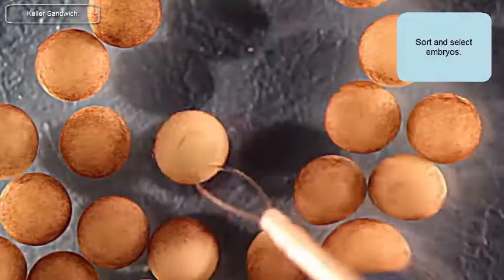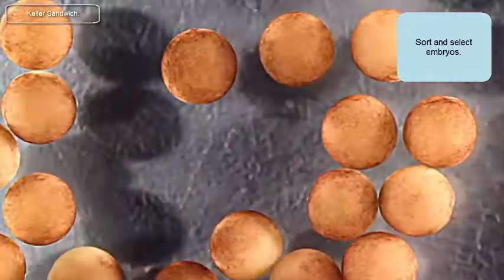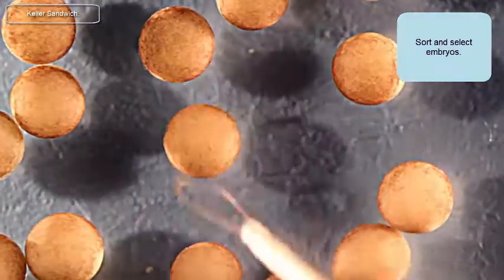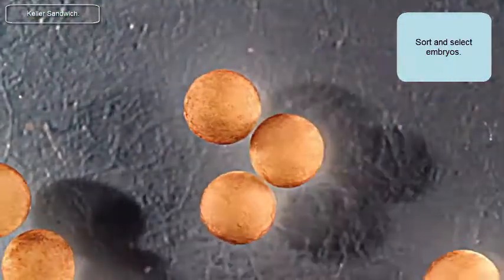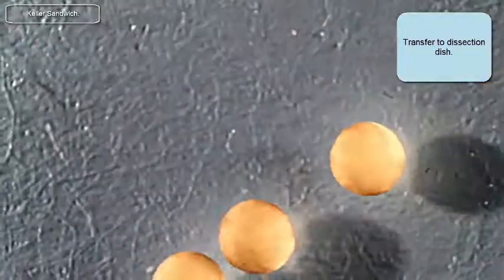With this video, I'm going to demonstrate making the Keller Sandwich. The Keller Sandwich is formed from two dorsal marginal zone explants. The video I'm going to show you first goes through the making of a dorsal marginal zone explant and then making a second one. So first, to isolate — to identify the stage you want to work with.